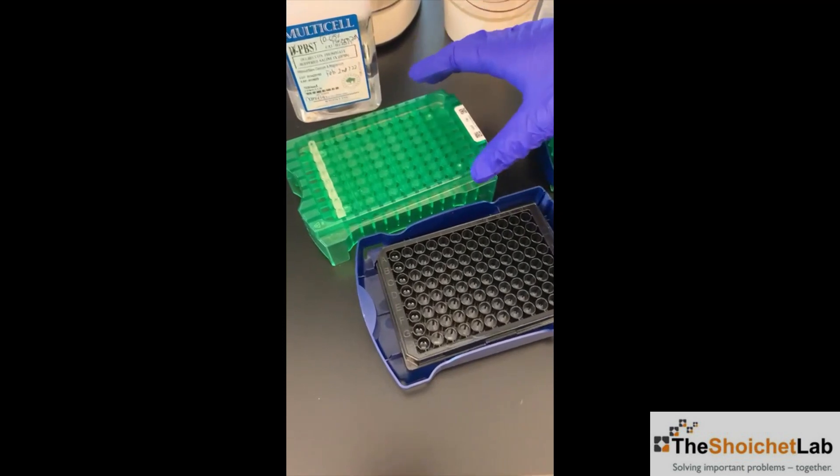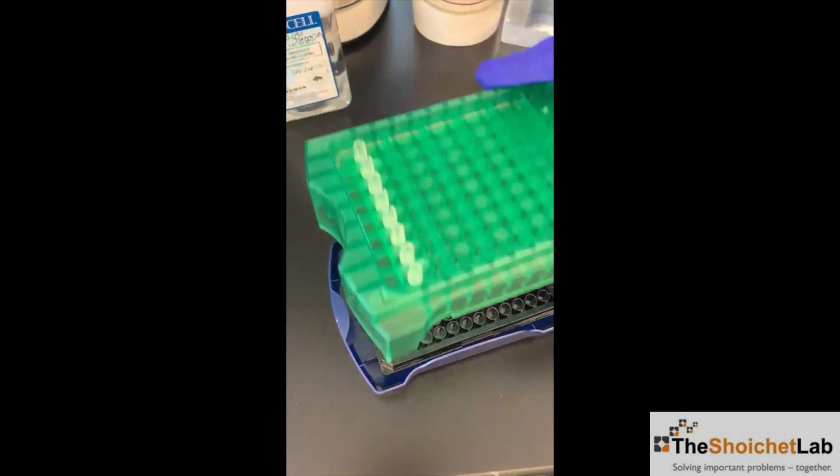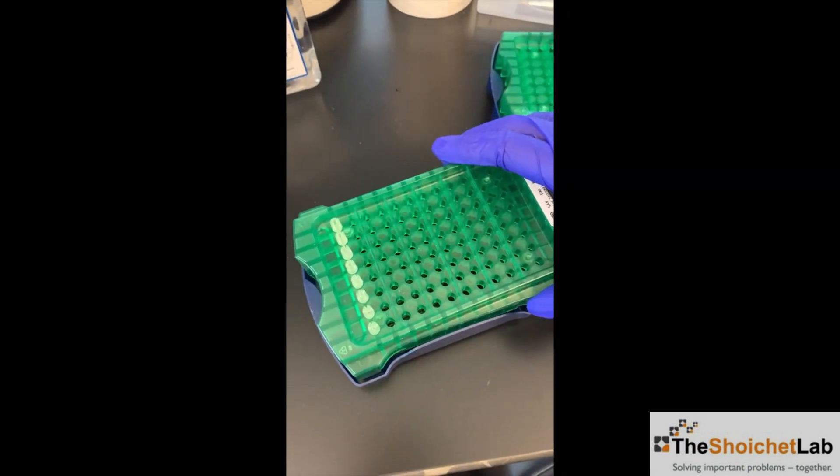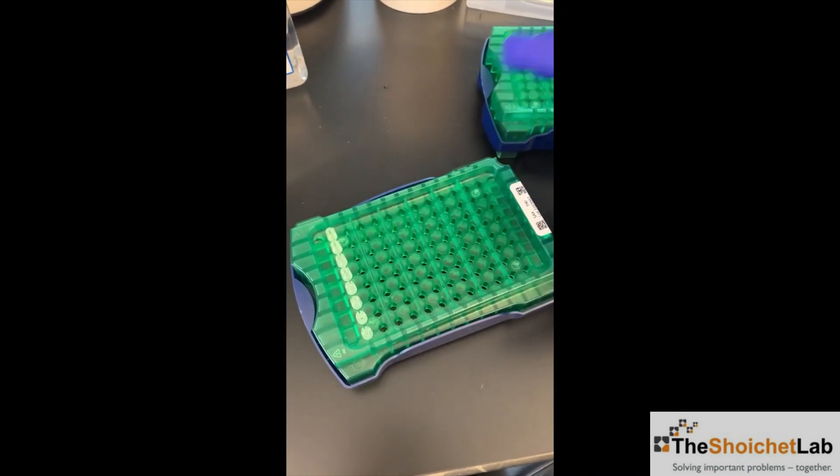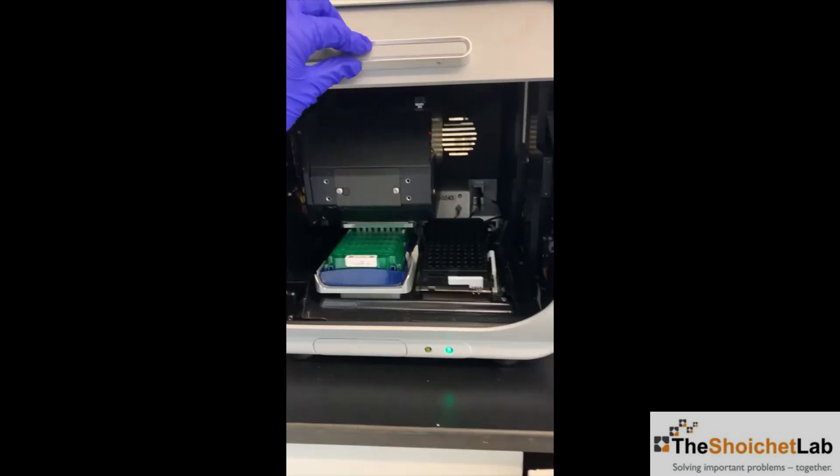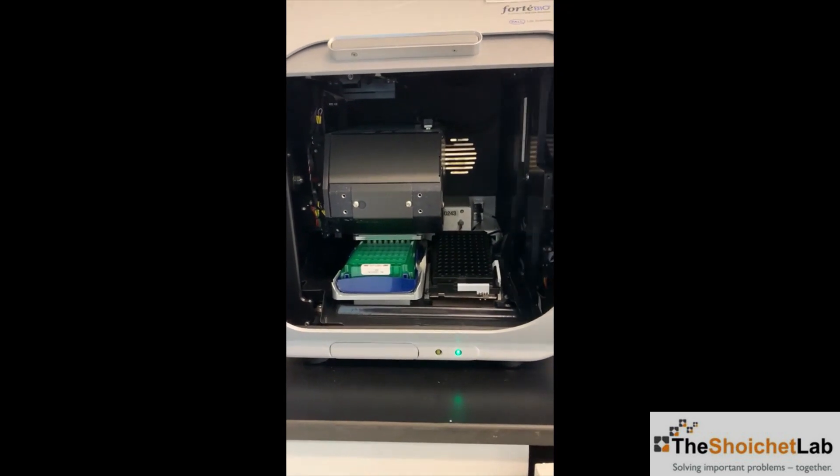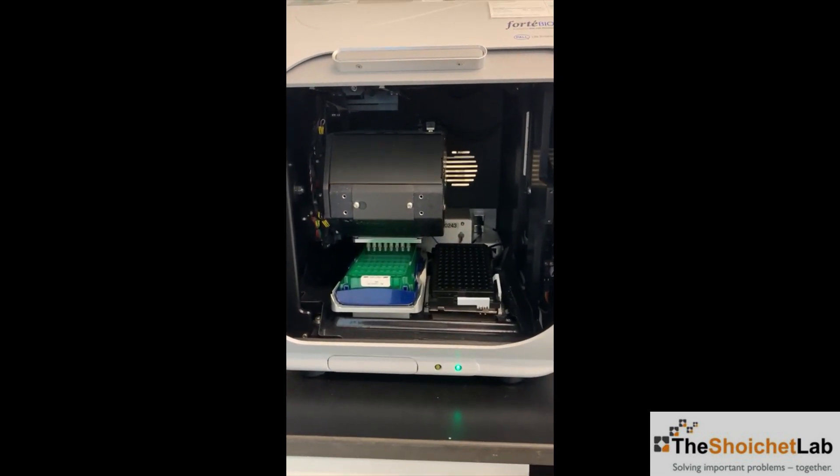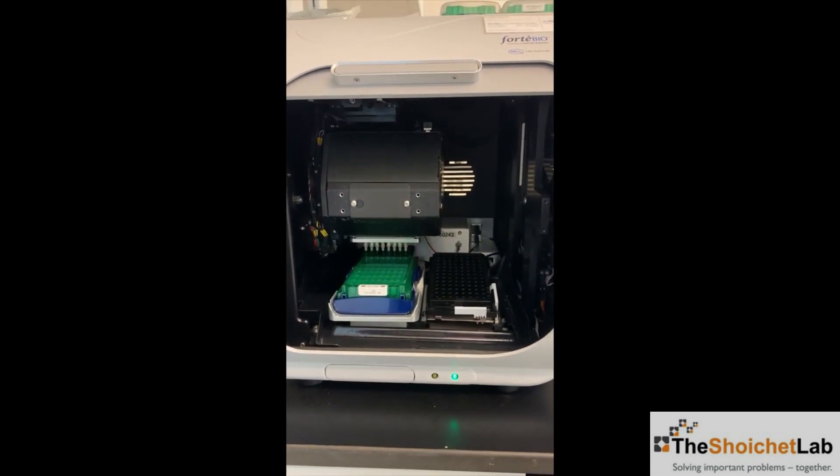Before starting the experiment, the sensors need to be hydrated for 10 minutes into buffer-only. Next, the sensor tray and 96-well plate are placed into the octet machine, as shown in the video.